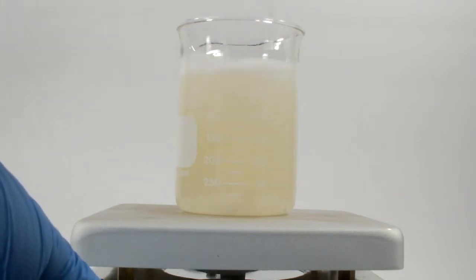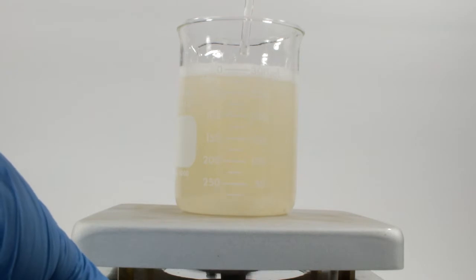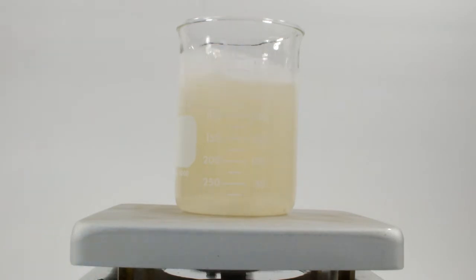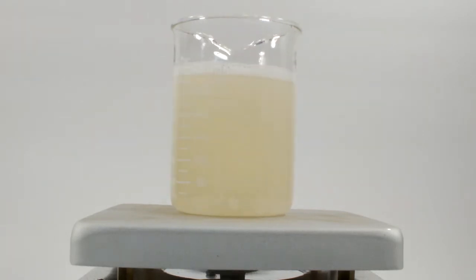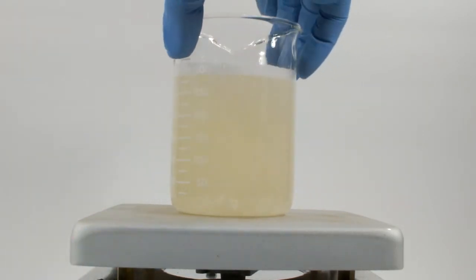Notice that there is some foaming up on top. We did make soap after all. So don't agitate it too much or you'll have suds everywhere. Once it looks more or less homogeneous, we'll stop the stirring and put it into a storage bottle.